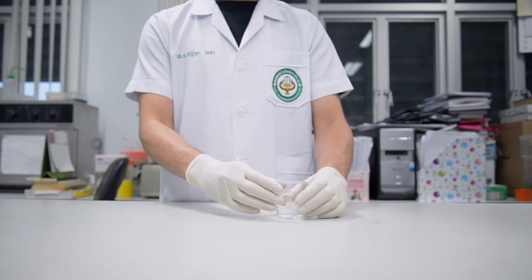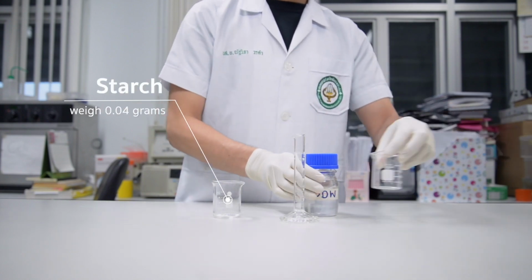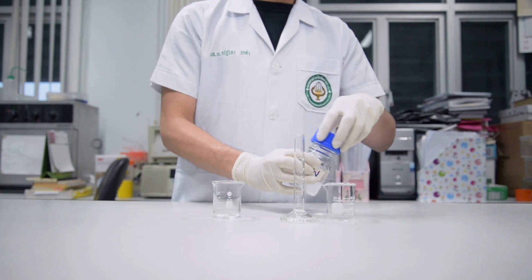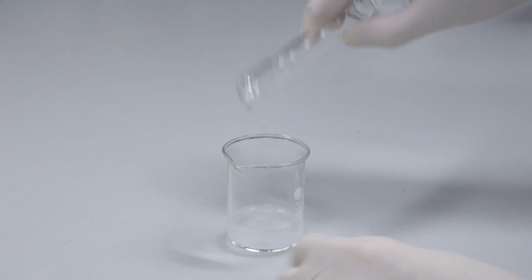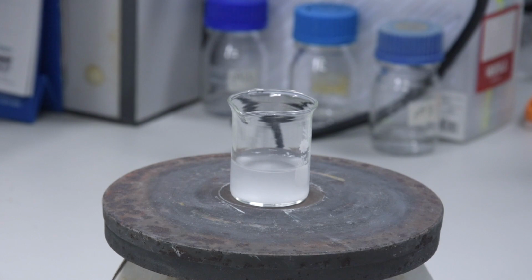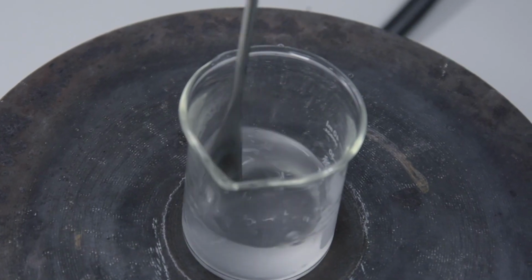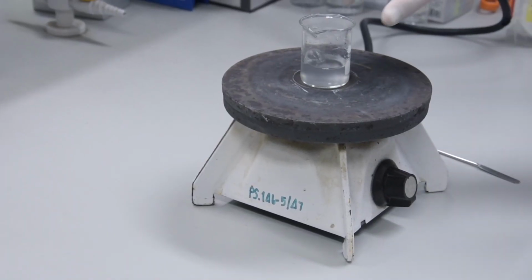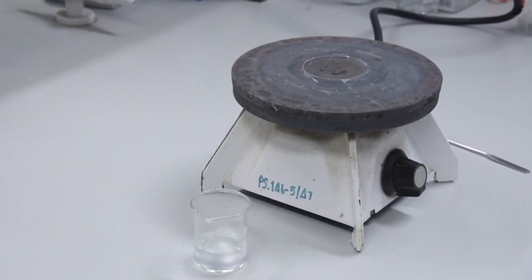First, the gelatinized starch is prepared by adding 0.04 gram of starch into a 50 ml beaker. Then, add 20 ml of distilled water and stir gently before bringing it to a boil on a hot plate at 100 degrees Celsius for 3 minutes. During this step, stir slowly until the solution is clear. Then, the gelatinized starch solution is cooled to room temperature.